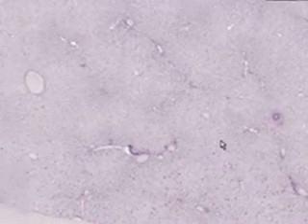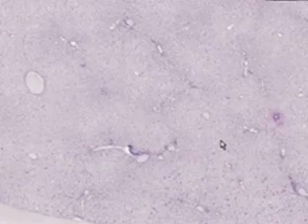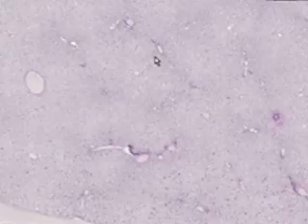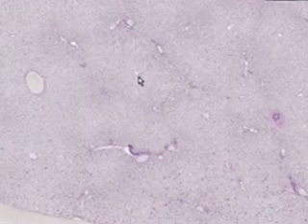Let's go back down, and I want you to try to remember one thing forever. Even though the liver lobules are classically described as being hexagonal, in other words, like little hexagons, it's very, very rare to actually see perfect hexagons. So what you have to do is look for the little open spaces like this, which is a central vein.